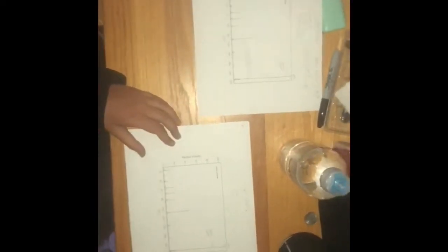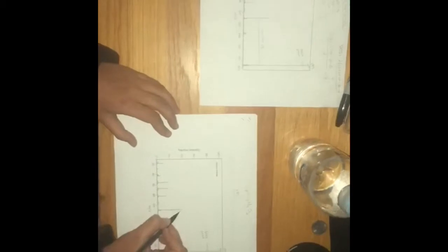So we can try to figure out if there's any other fragments in this, and you can do that by maybe subtracting this peak right here, which is 109, and you get 85, but that doesn't match with the formula, so we're going to ignore that number.